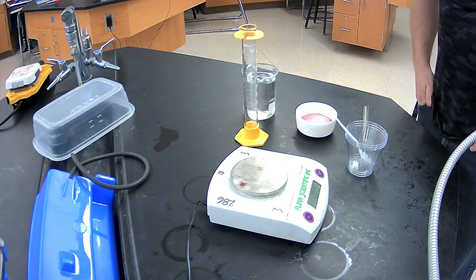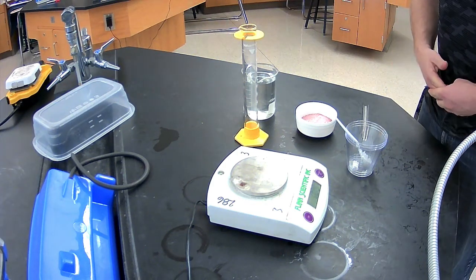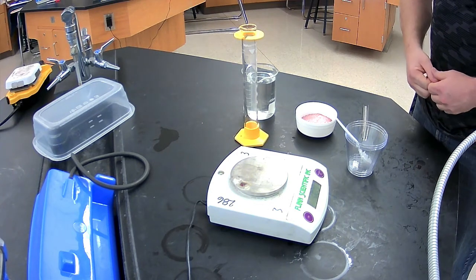In this video we're going to first make our stock solution of our Kool-Aid compound.